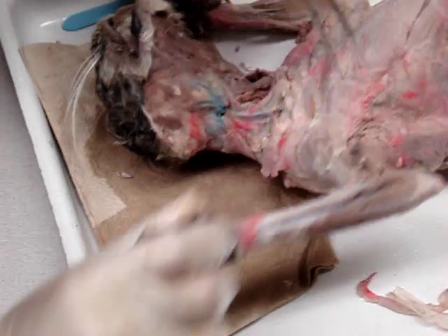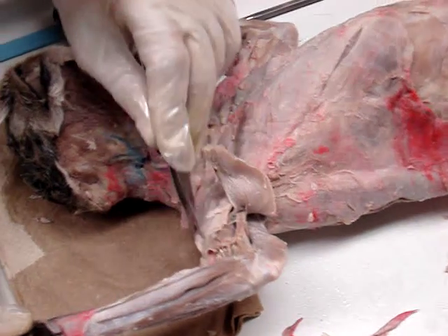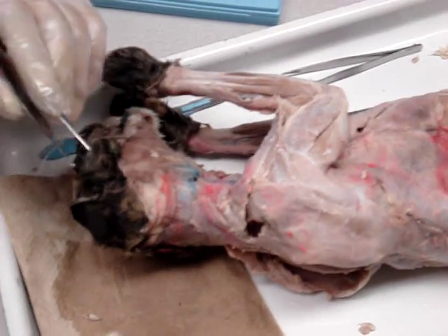Alright, that's it. That's today's plan. And you know where the epitrochlearis, tricep brachii, bicep brachii, and brachialis are. That's today's plan.